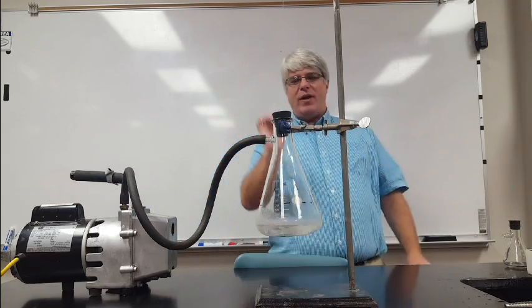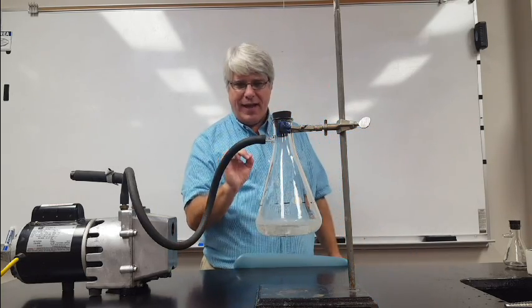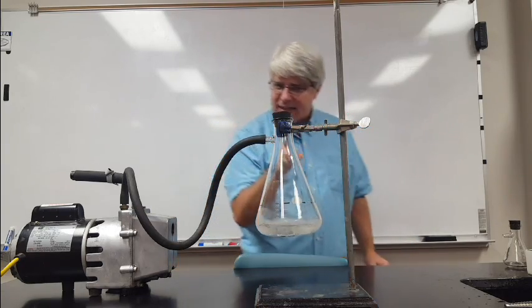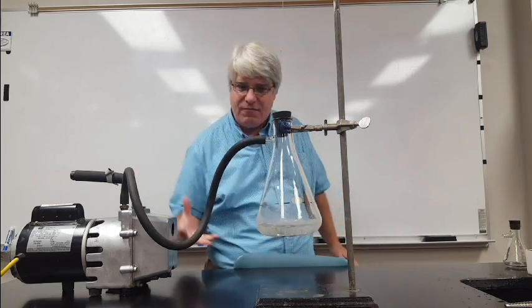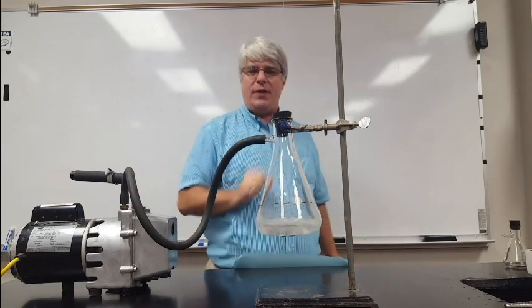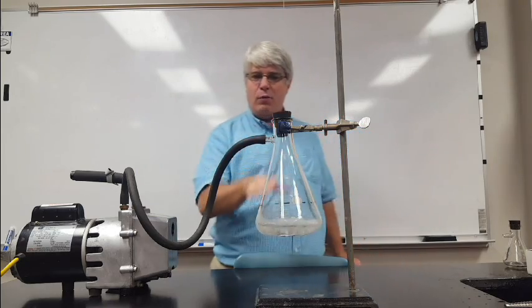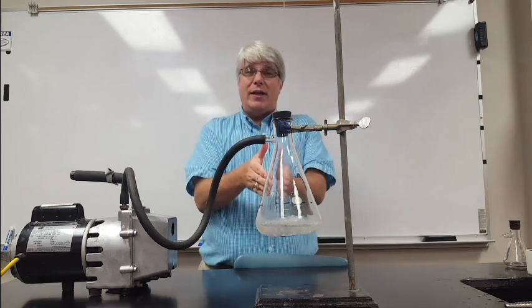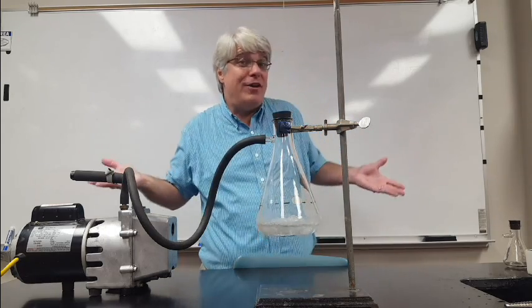Because the liquid is getting colder, it's actually starting to freeze. A solid is forming. That solid is forming because as the vapor escapes, it takes energy with it which cools down the liquid, and eventually the liquid gets cold enough to reach its freezing point. So I am essentially boiling this liquid in order to freeze it.